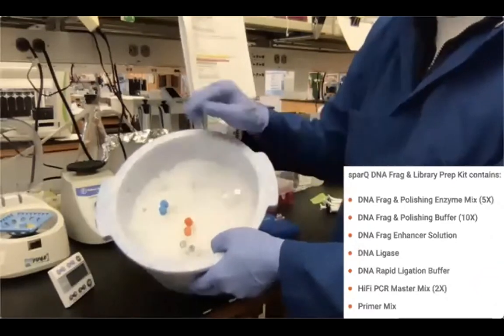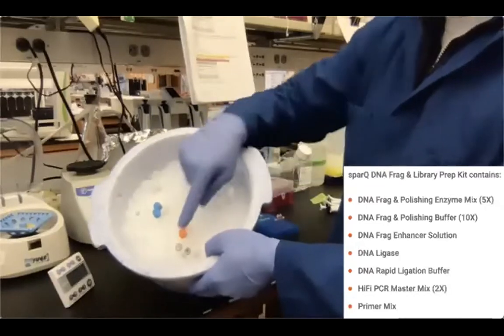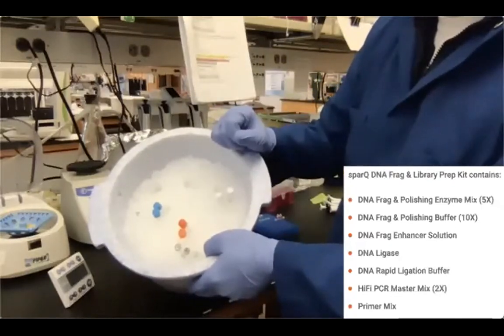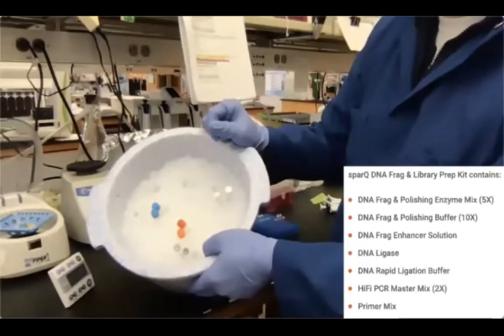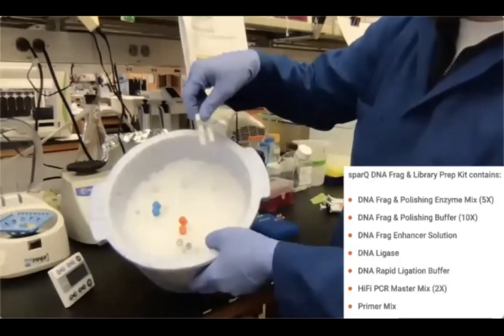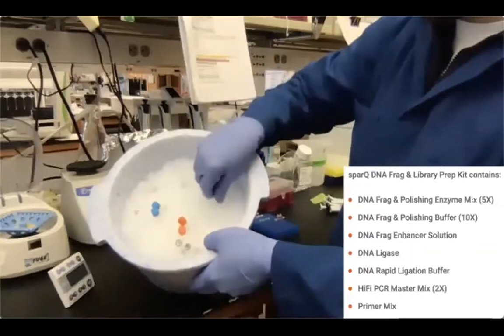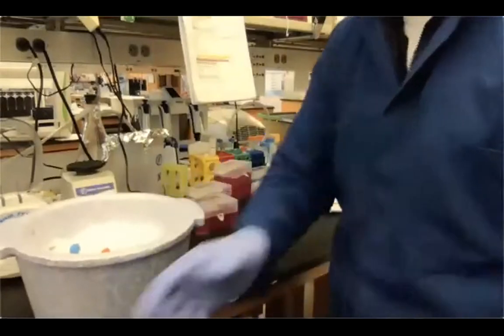So this is a really important step. Every time you're preparing more than one sample at the same time, please use different adapters. So whenever you are sequencing those libraries in the same lane, then you can distinguish the reads coming from each library depending on the tag of the adapters, okay? And then we have the two reagents for the last step, which is the PCR amplification, okay? So we are basically ready to start, and let's get to some pipetting, okay?